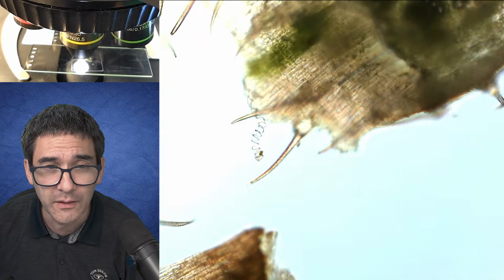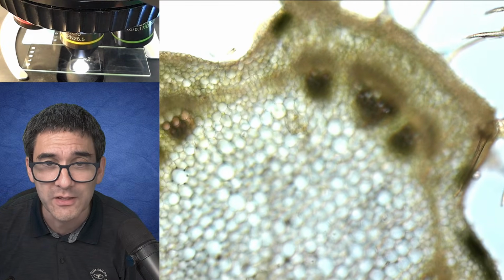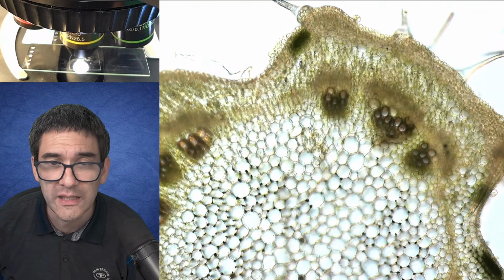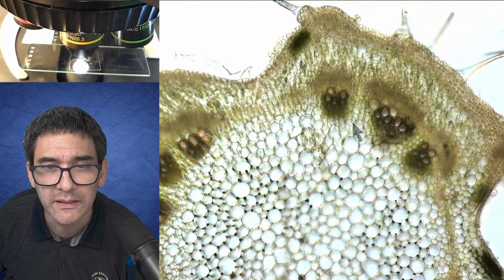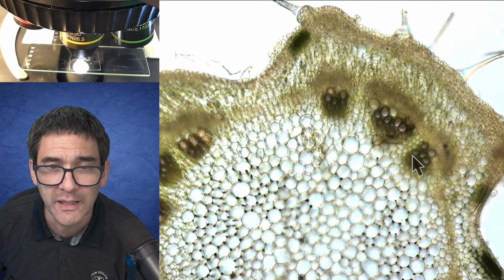And this is clearly a dicot plant. Why? Because the vascular bundles, basically the xylem and the phloem, are arranged in a nice circular pattern. So you see those vascular bundles here? Again, my mouse is acting up a little bit, maybe the battery, I've got a wireless mouse. These are the vascular bundles. You see they're arranged in a ring shape here. That's very typical of a dicot plant.